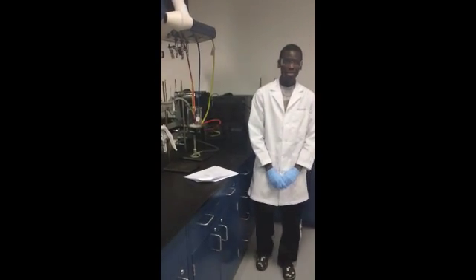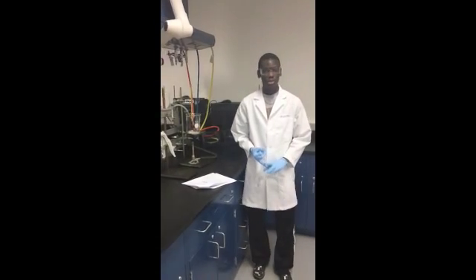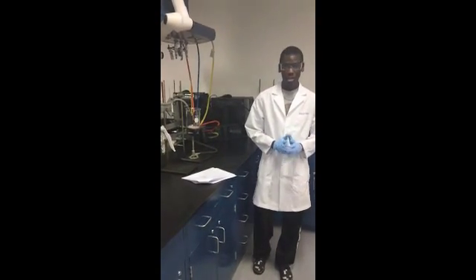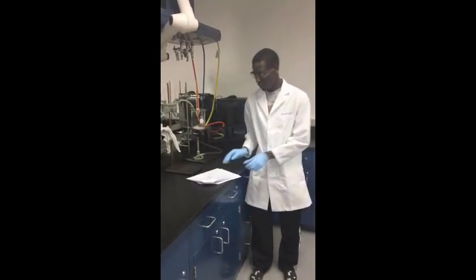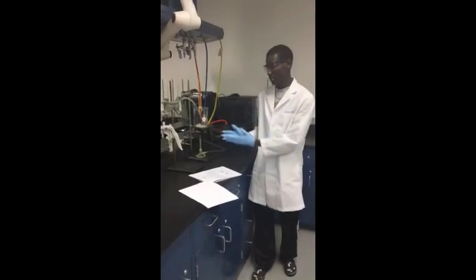Before we begin our experiment, you first need to record the atmospheric pressure and the temperature of the lab, and record each to the proper significant figures in your lab notebook. And then, please refer to figure 7-2 in your lab handout for the setup.